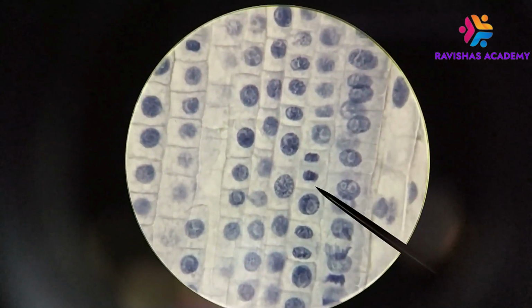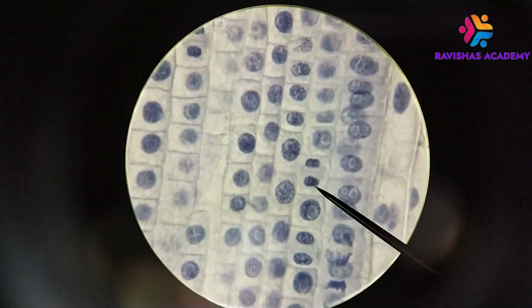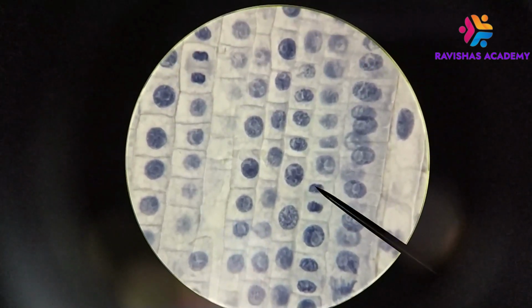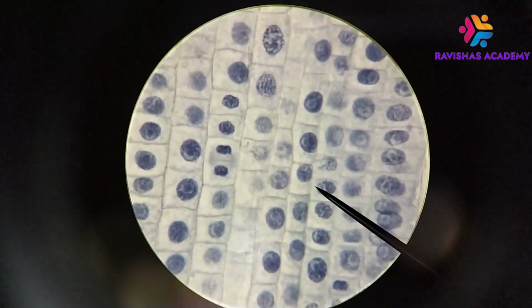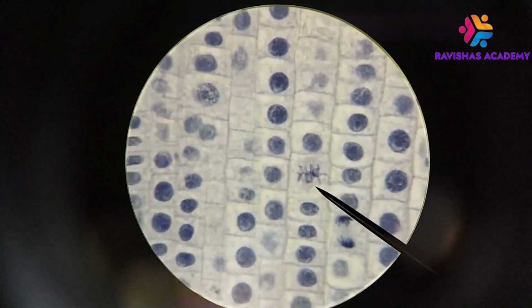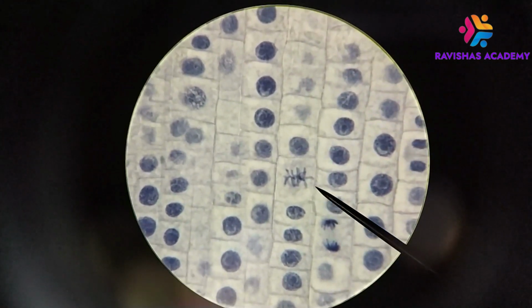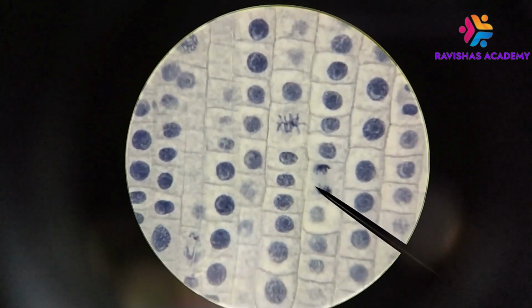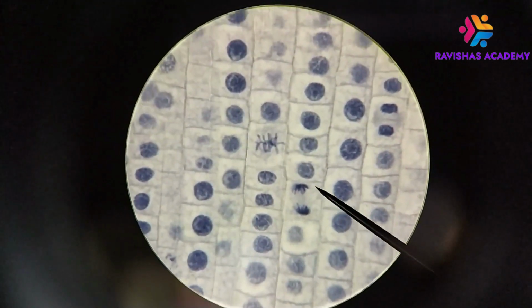Here's another example where we're seeing these chromosomes starting to form more rounded structures that will become the nuclei. And again, if you look around them, lots of the nuclei around here are just simply doing interphase. Okay, again, here's another example of metaphase. Again, chromosomes are all lined up on the metaphase plate. And down just a little bit below, we can see another cell undergoing anaphase.